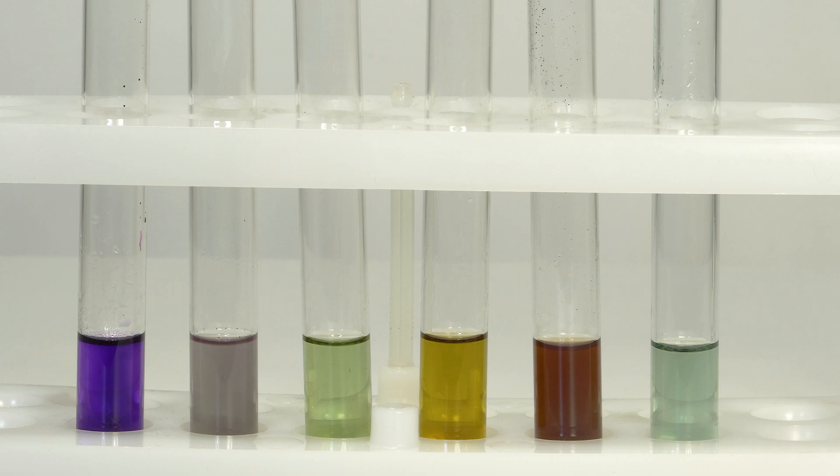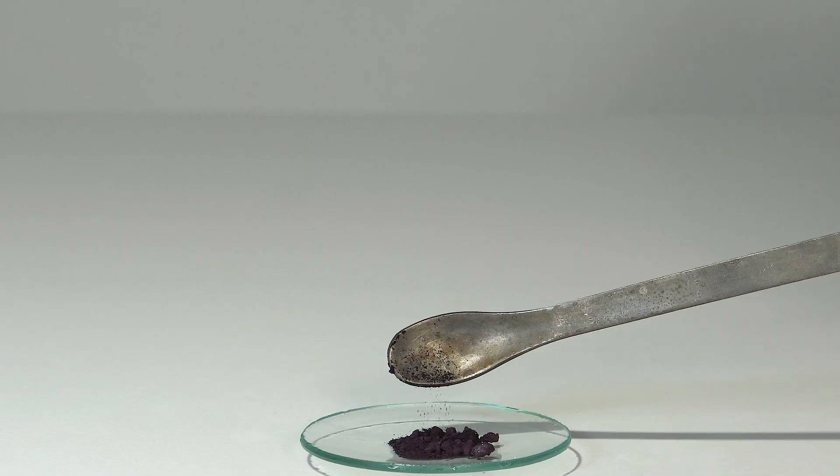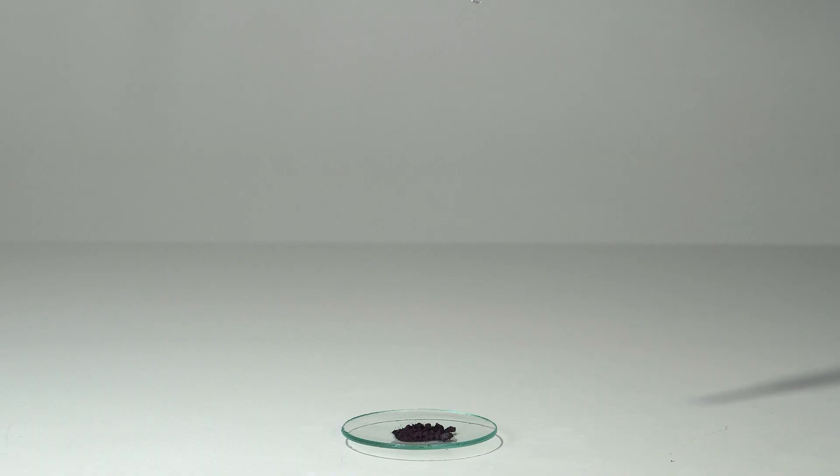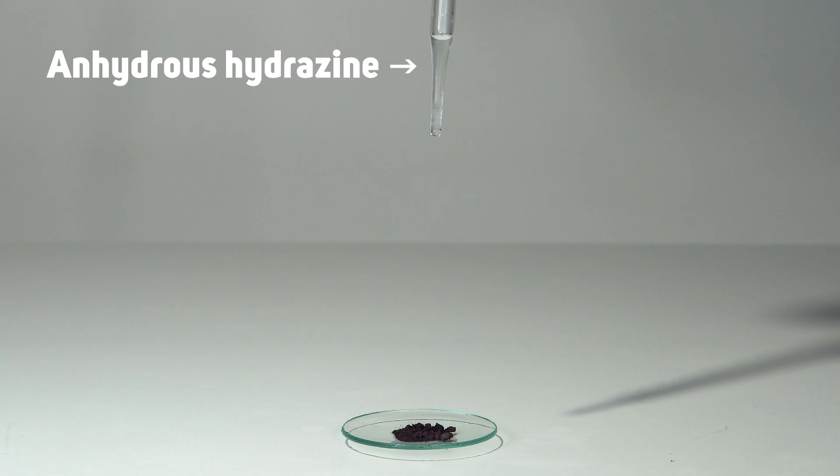As with all other vanadium compounds, anhydrous hydrazine reacts very violently with vanadium trichloride.